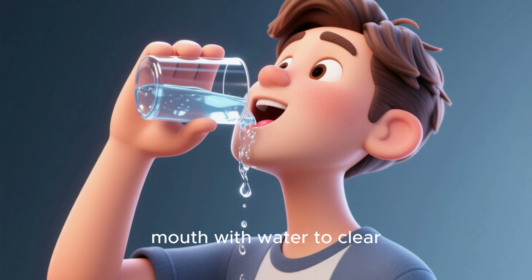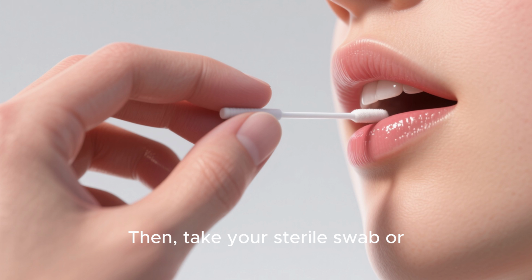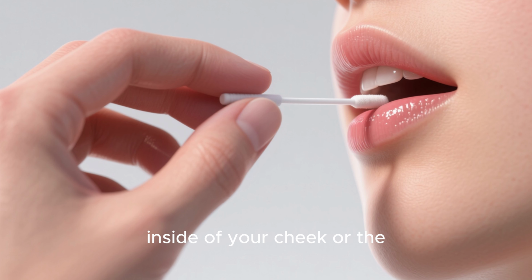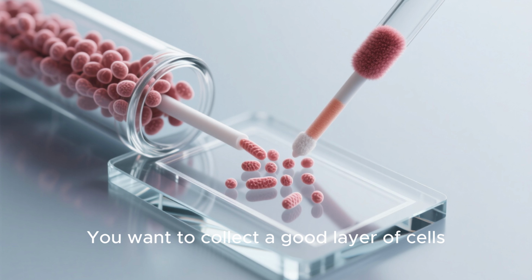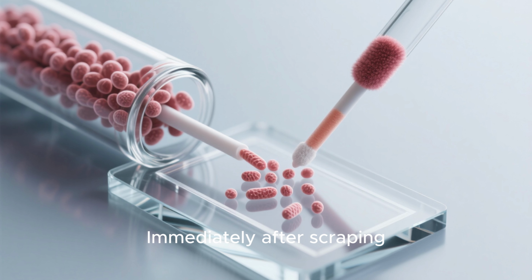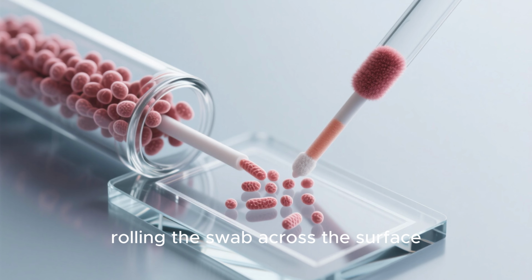First, rinse your mouth with water to clear away any food, debris, or loose cells. Then, take your sterile swab or brush and gently but firmly scrape the inside of your cheek or the side of your tongue. You want to collect a good layer of cells. Immediately after scraping, you'll transfer the cells directly onto a clean glass slide by rolling the swab across the surface.